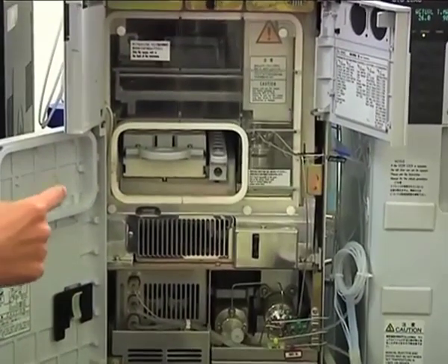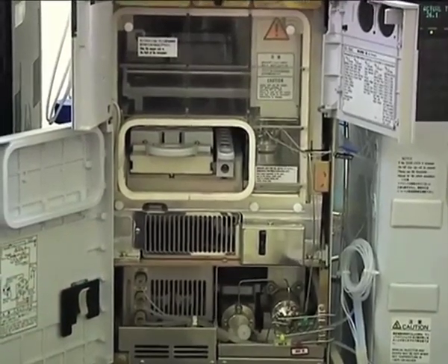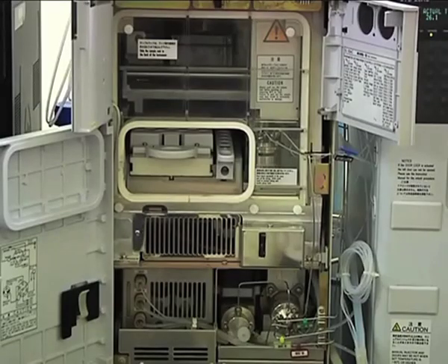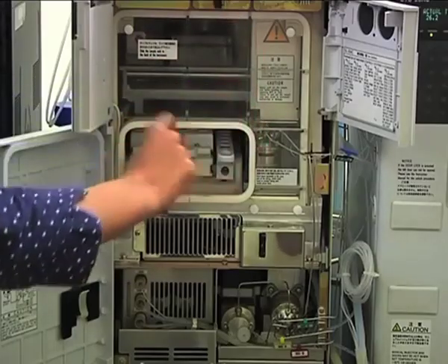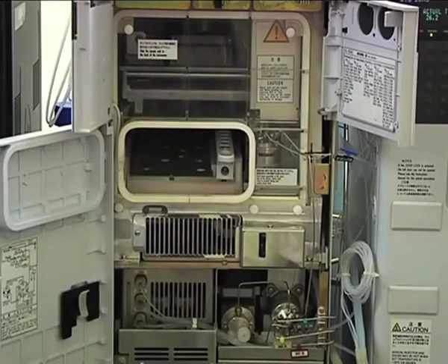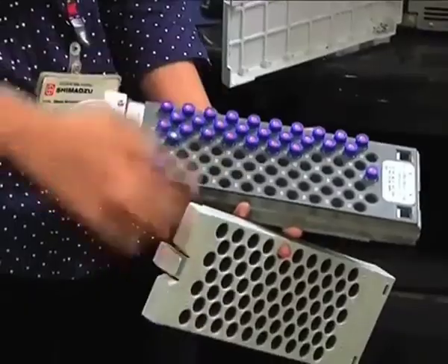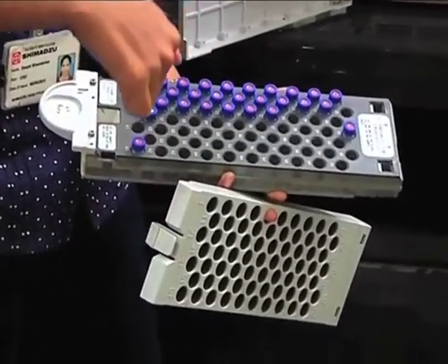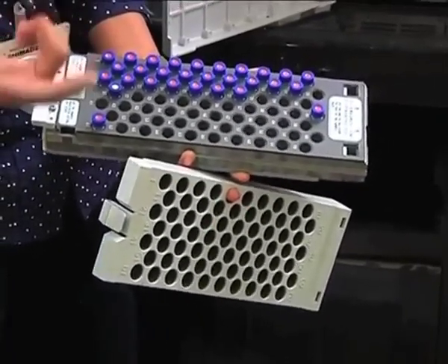Okay. Now the feature of this auto sampler is it gives you very low carryover. It is almost near zero carryover. So what do you mean by carryover? You have to understand how injection happens. There is a needle, right? You will put your samples in these auto sampler vials like this. You will fill in the vial and the needle will come and pierce through this vial and take the sample. So the outer surface of the needle is coming in contact with the sample.